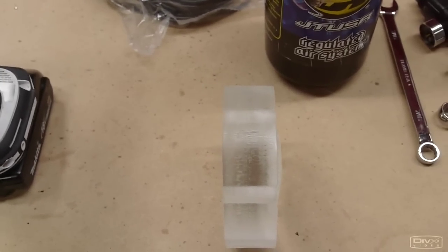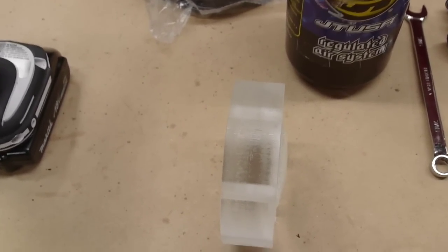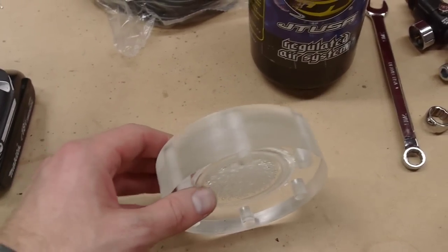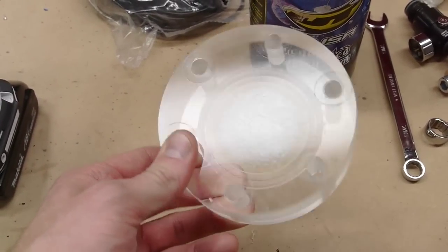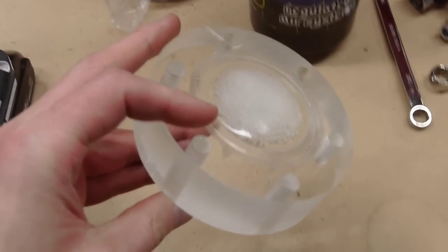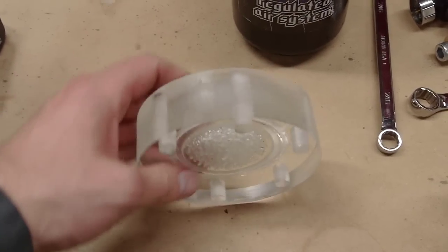So here's an interesting development. I left my supercritical CO2 chamber charged up with liquid CO2 for a week and then decompressed it, and look what happened. Whoops. Now, the chamber was not supercritical for the whole week.